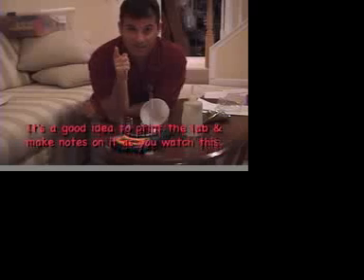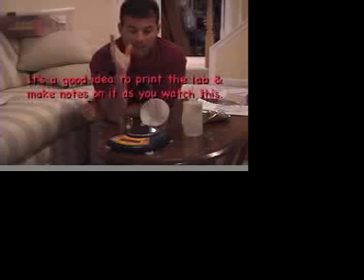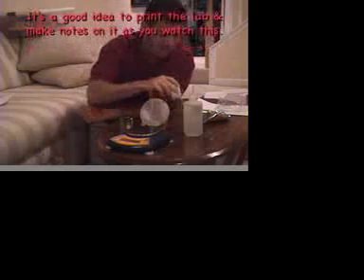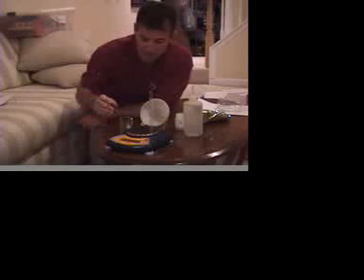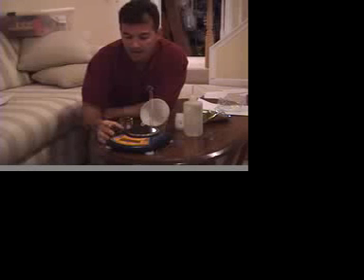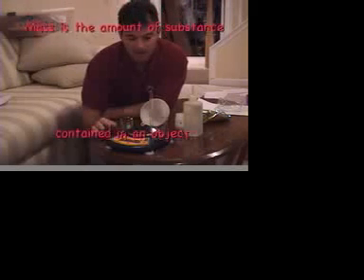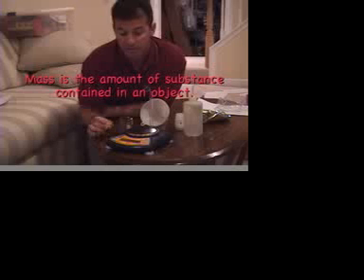One of the things you're asked to do is to weigh a random sample of tin, okay? So this little medicine looking jar is your tin. It looks like buckshot, for those of you that know what that looks like. And this is an electronic balance scale that's going to actually calculate the mass of the tin. Mass and weight aren't exactly the same thing, but mass on the planet Earth and weight act very similarly. Feel free to ask a physics teacher and they'll give you a dissertation on it, which will be quite wonderful.